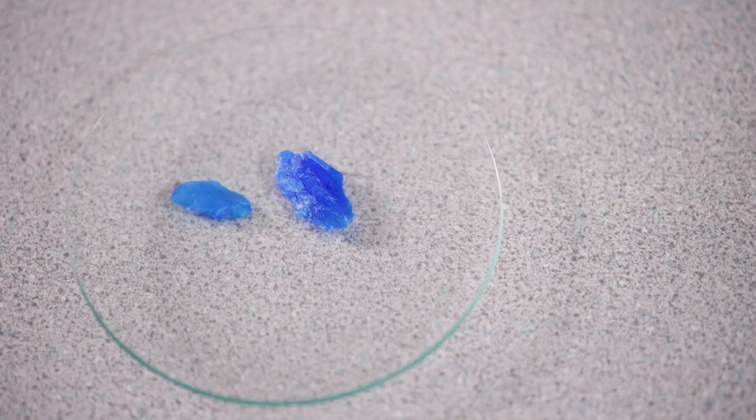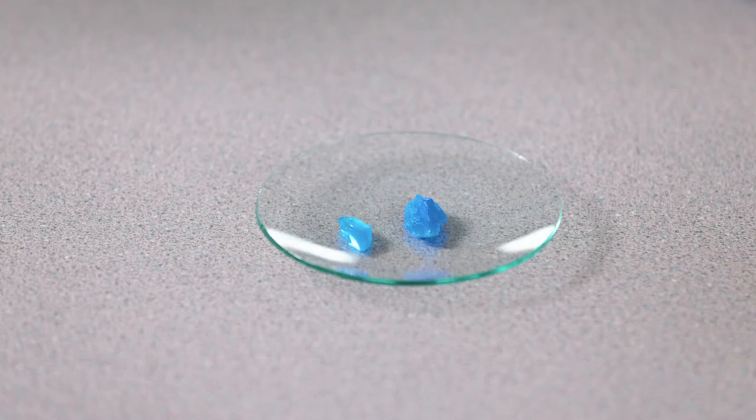If too much heating has been applied, then your crystals will be considerably smaller and less impressive. In this practical, I have demonstrated how to prepare a pure sample of hydrated copper sulphate crystals. It would be a good idea for you to reflect on the techniques I have used today and your teacher may provide you with further questions to help you understand this practical in greater depth.